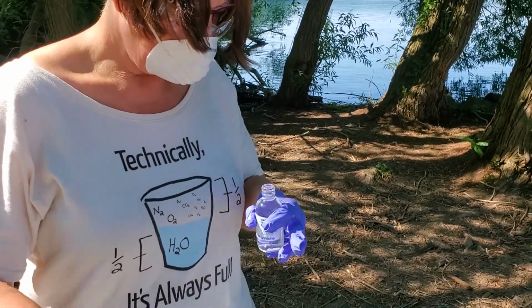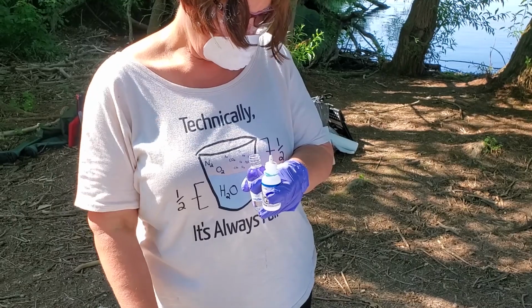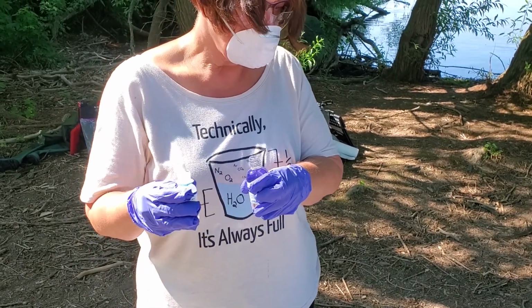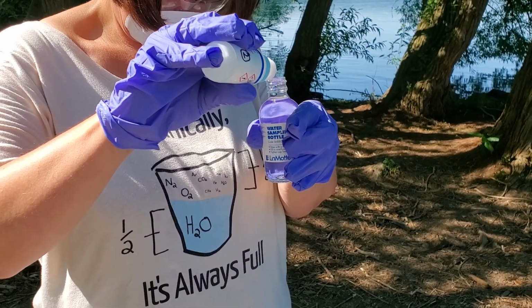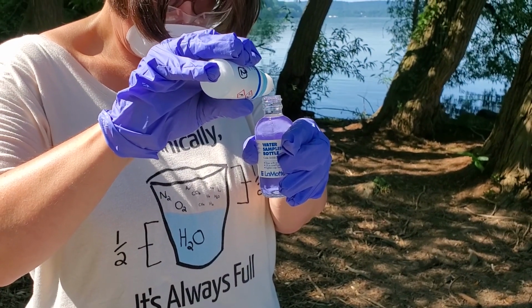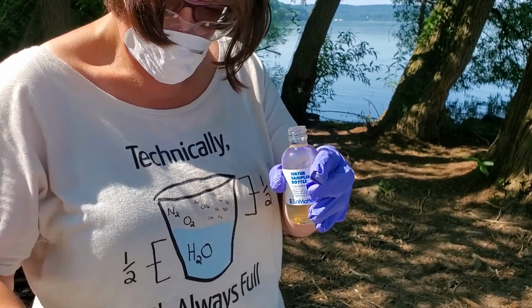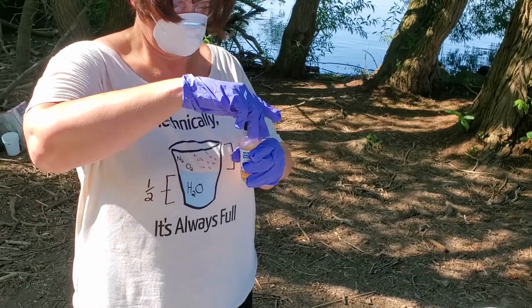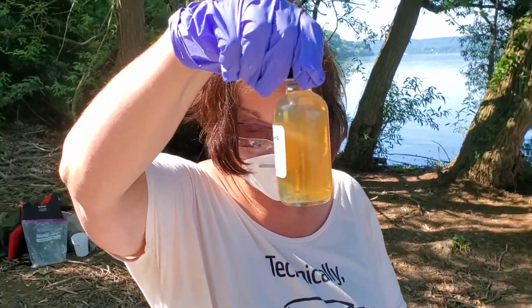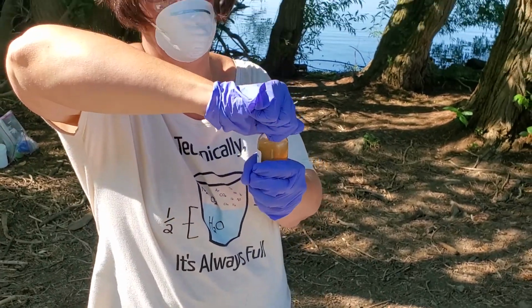Then immediately I'm going to take bottle number 2, which is alkaline potassium iodide azide, and put 8 drops of that into the solution. 1, 2, 3, 4, 5, 6, 7, 8. Then I'm going to immediately cap the bottle. And you will notice a color change as a precipitate forms.